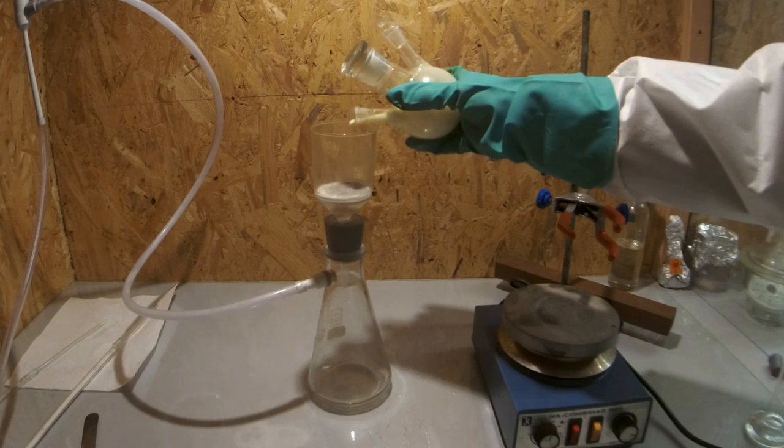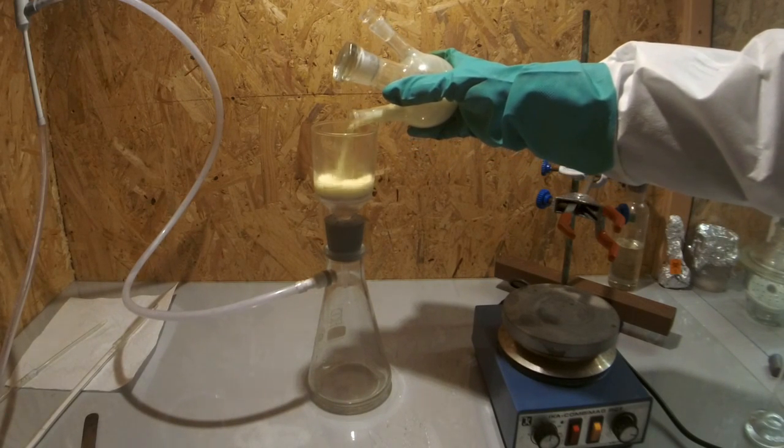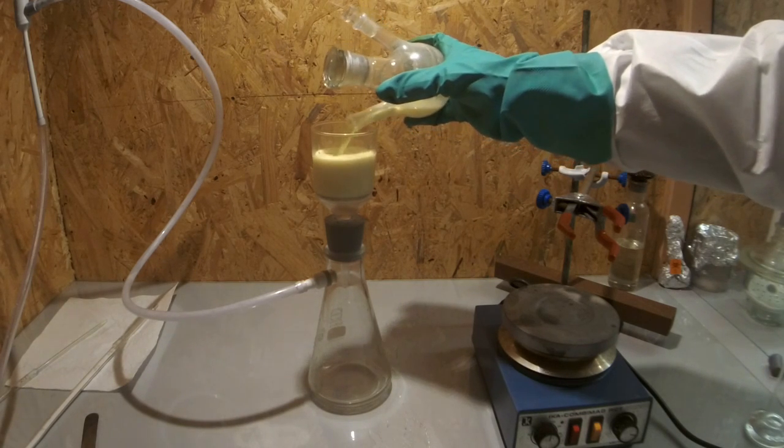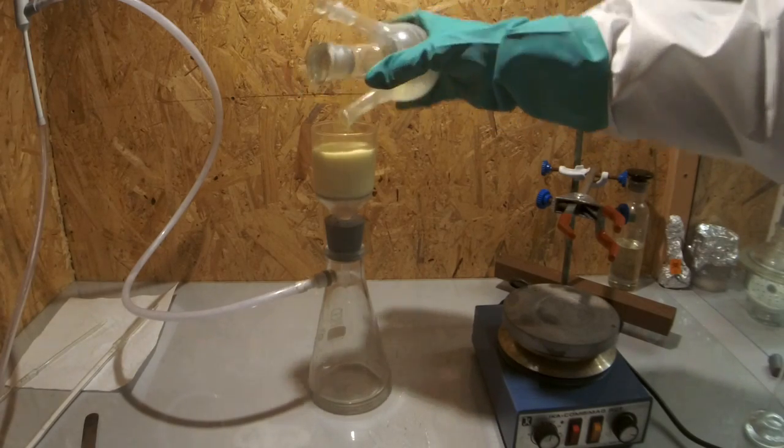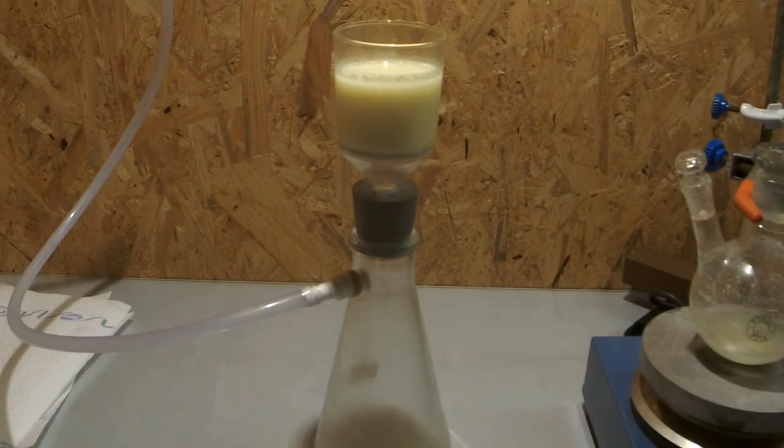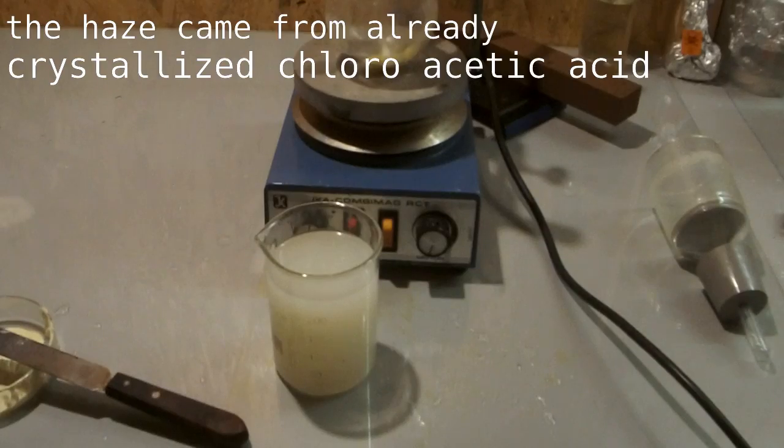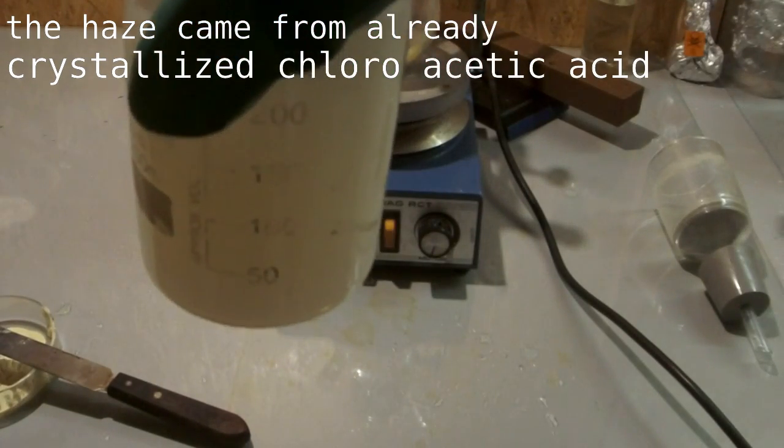After that I cooled the product mixture down and the haze or dust in the mixture came from already crystallizing chloroacetic acid. So now you just have to evaporate the water and you will have chloroacetic acid. So have fun with it and don't kill yourself.